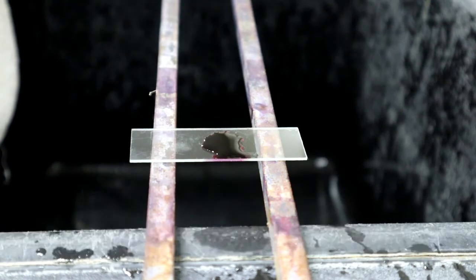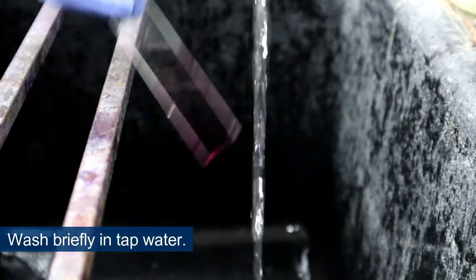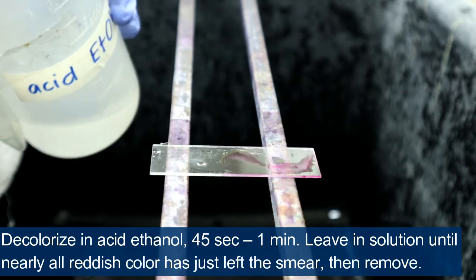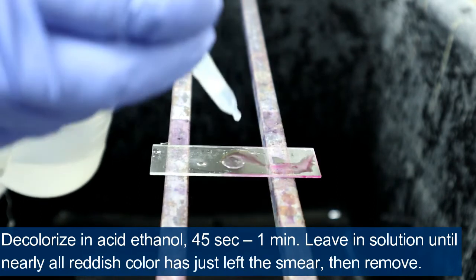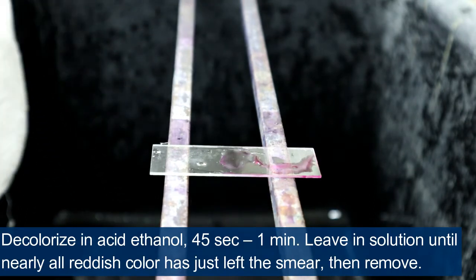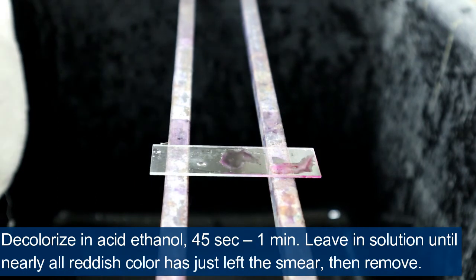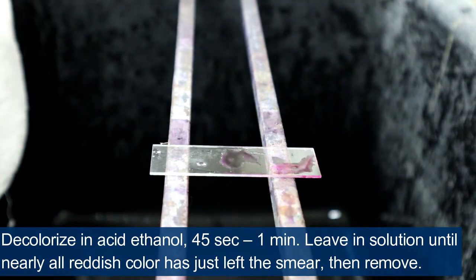Wash briefly in tap water. Decolorize in acid ethanol for 45 seconds to 1 minute. Leave in solution until nearly all reddish color has just left the smear, then remove.